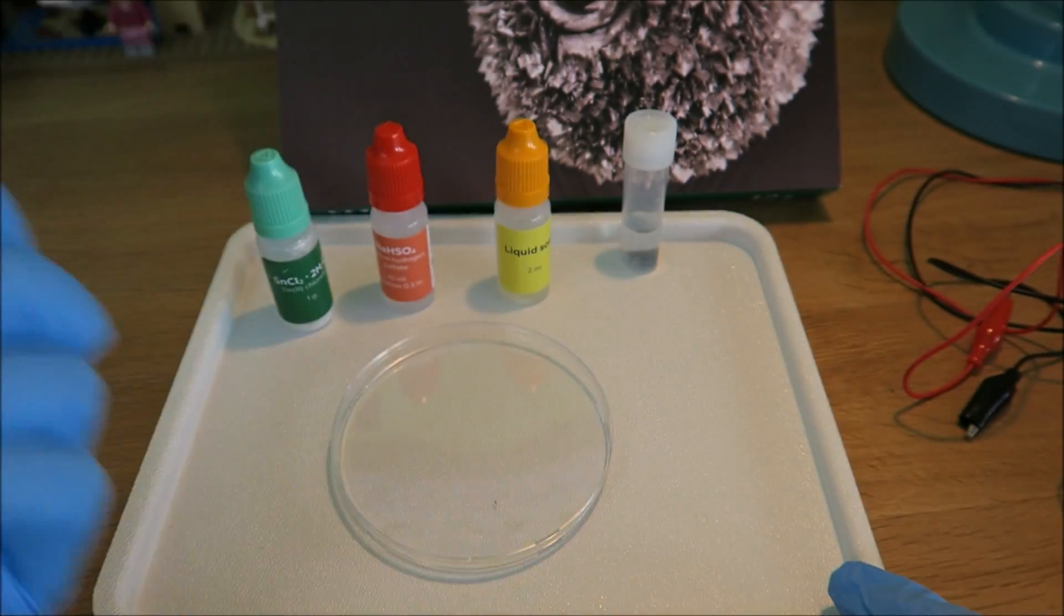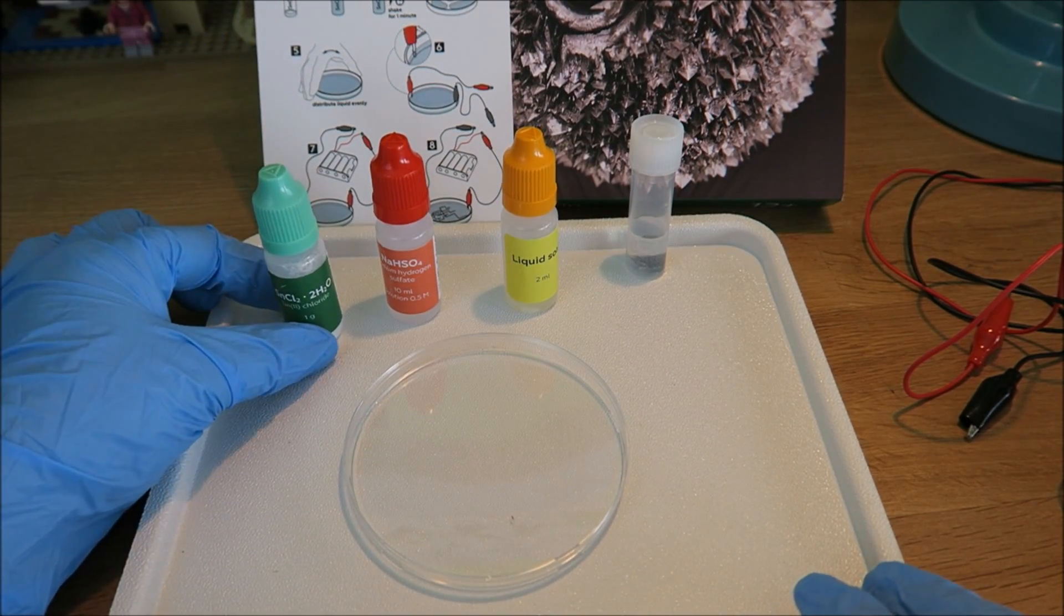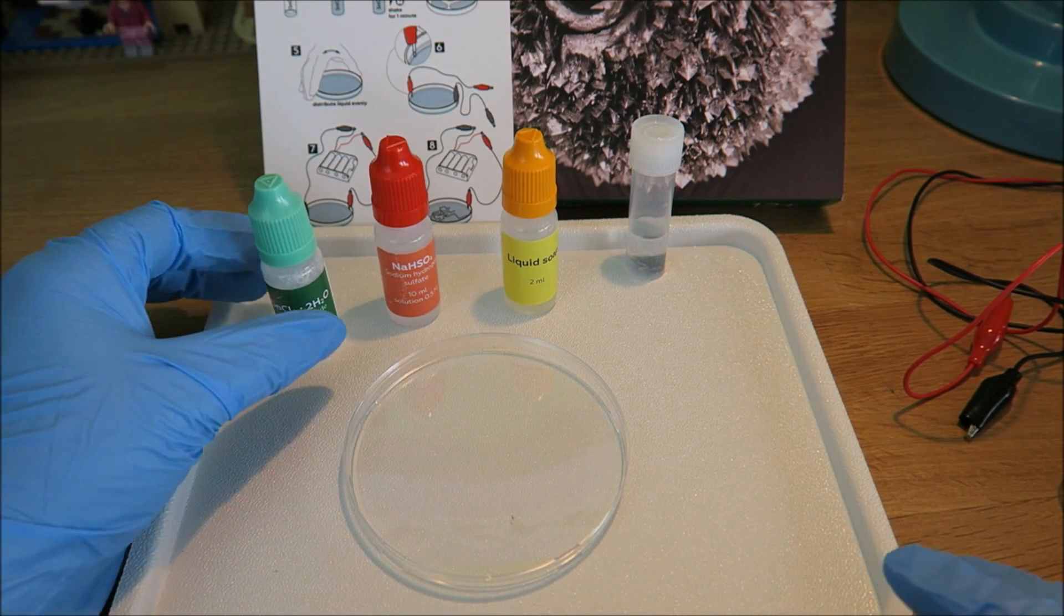Tin dendrites, pop my nice instructions there. We have tin chloride, we have sodium hydrogen sulphate, and we have liquid soap.